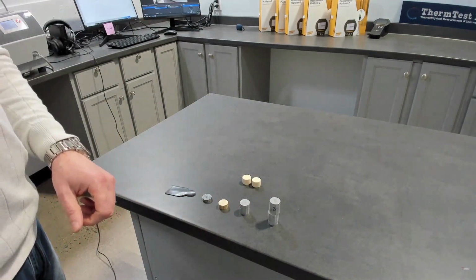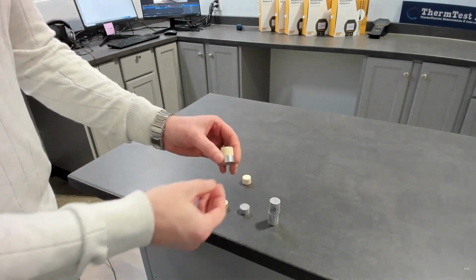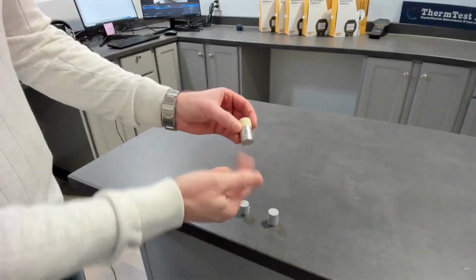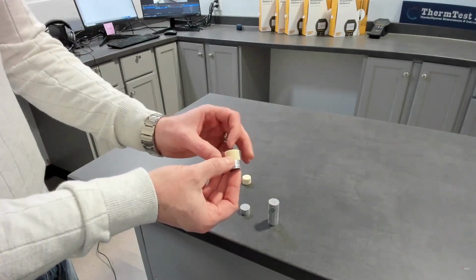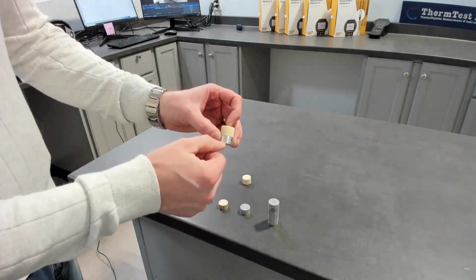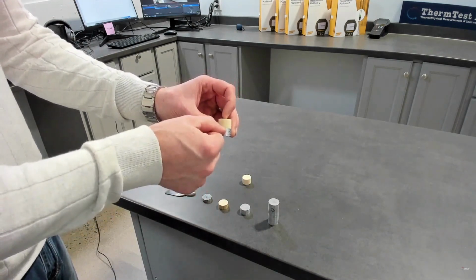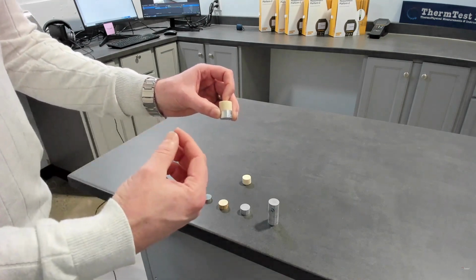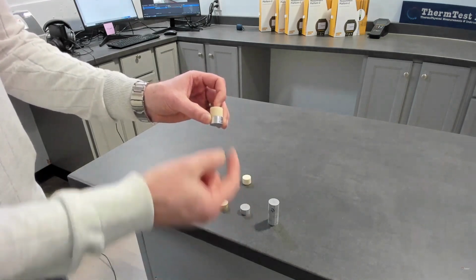So that's possible, but we've taken a major jump forward with our proprietary calculation, which allows us to take that same aluminum material, whatever the sample is, in a one-dimensional shape, and elongate it by putting a backing material or an insulation on top of the sample and inputting the thickness of the sample into the software. We now have a dimension. Using the boundary effects, the heat penetrates through the material, hits the boundary, and we have a defined dimension. We can measure directly the thermal diffusivity. So we know the thermal conductivity and thermal diffusivity, and the output of specific heat.